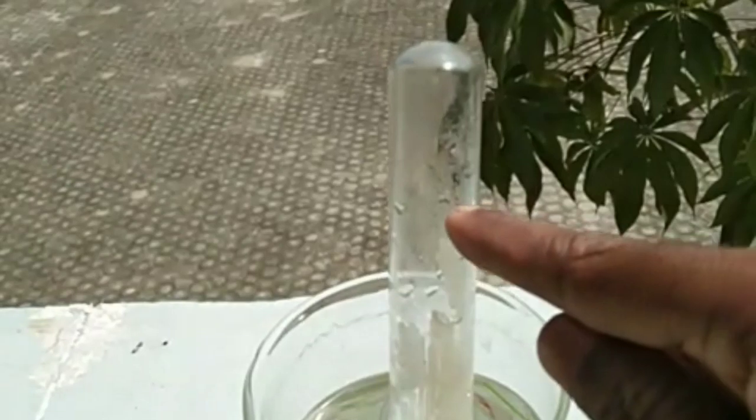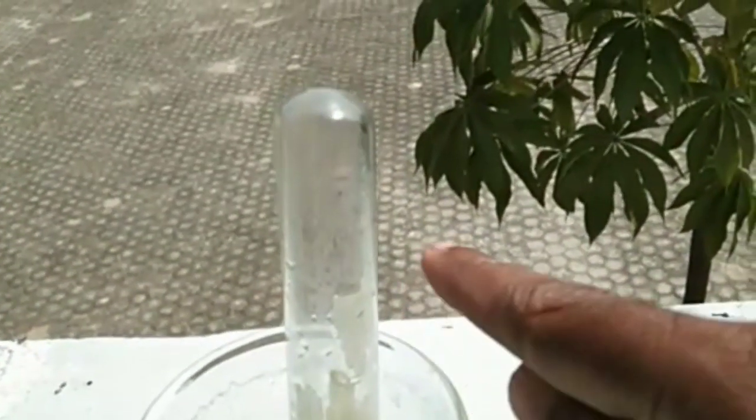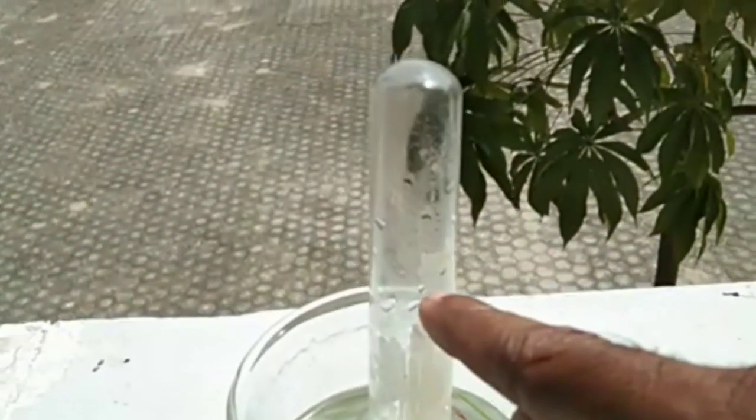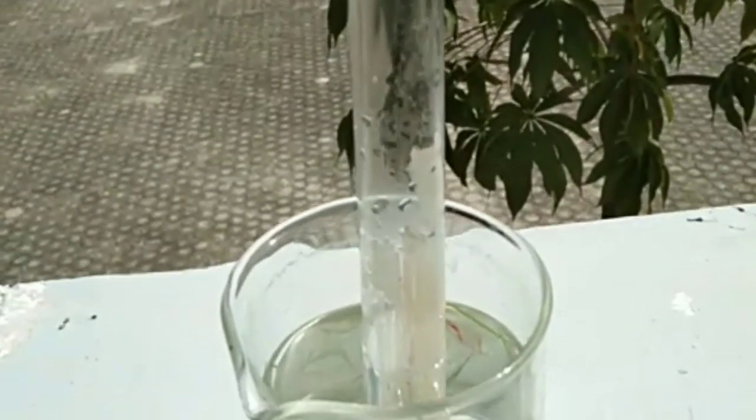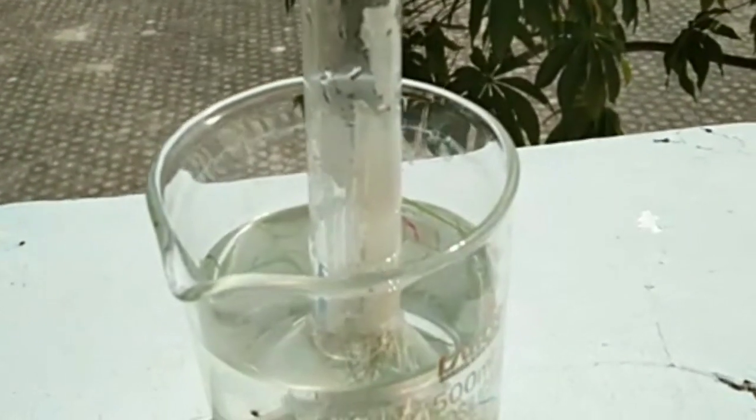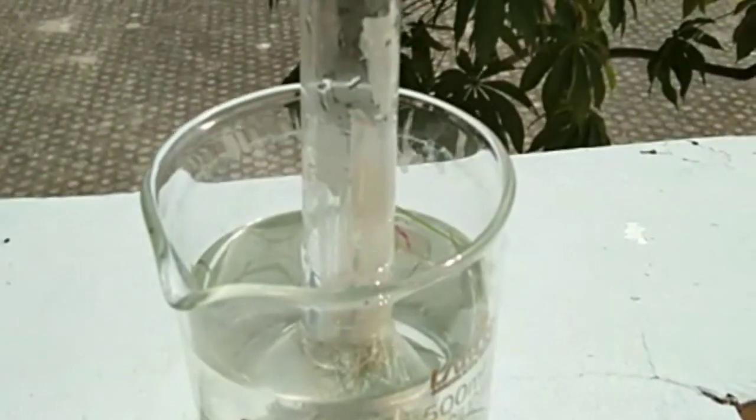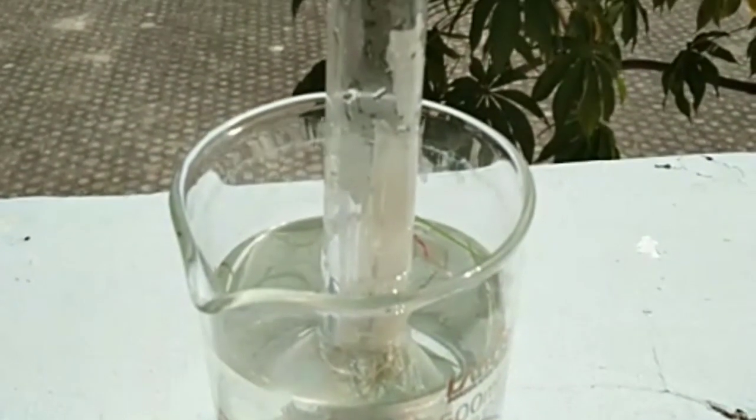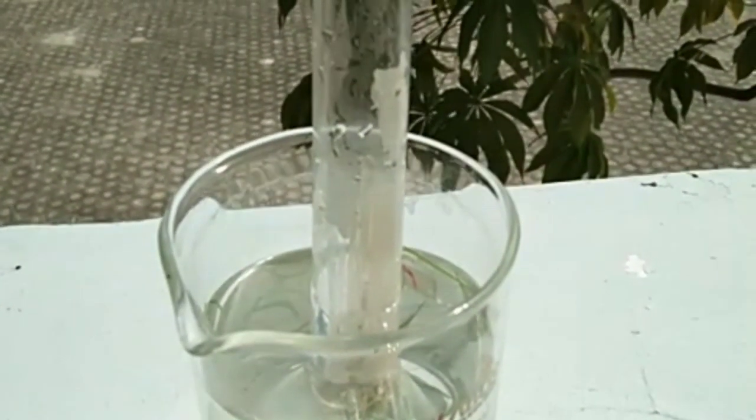Keep the apparatus in sunlight for two hours or three hours. After that, bubbles come out. See here, these are bubbles. These light bubbles show the presence of oxygen.